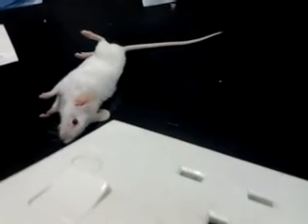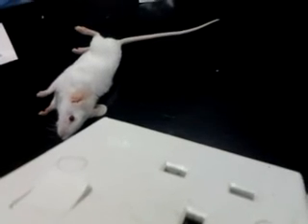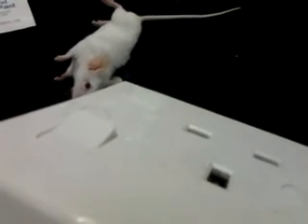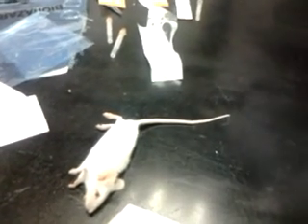Now I go for IM. You get another one more. See how fast the time. So you time this one, you time that, you see how fast they sleep and then how fast they recover.